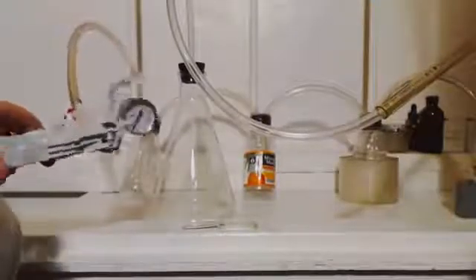Now at the end, instead of having a funnel going to another thing of sodium hydroxide, I got this pump. As you can see, I can squeeze it. You can see the bubbles coming. Each time I press it or pull the trigger, pull some air up, cause a vacuum, hoping that will help suck some of the nitrogen oxides I make out of the reaction and get it to react with the sodium hydroxide to make sodium nitrite.